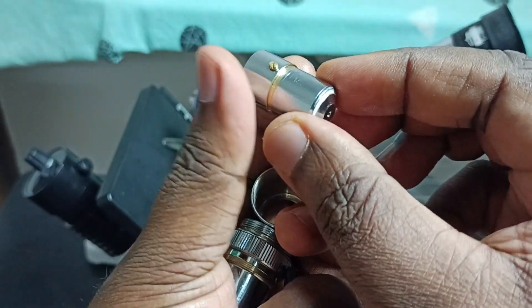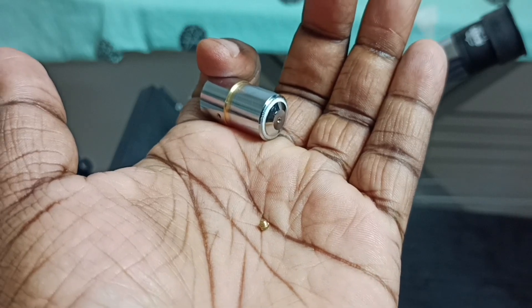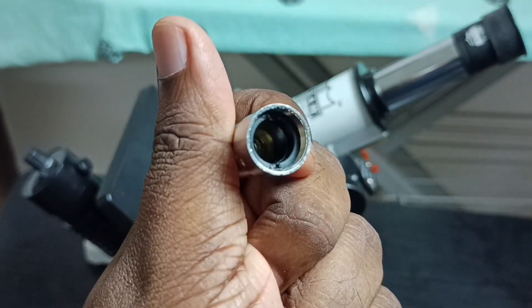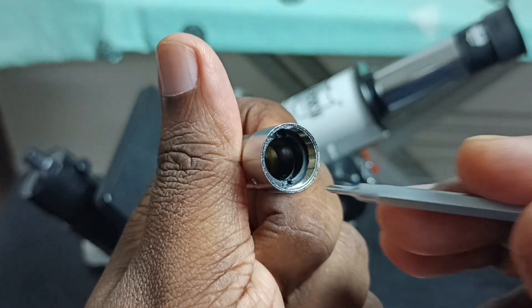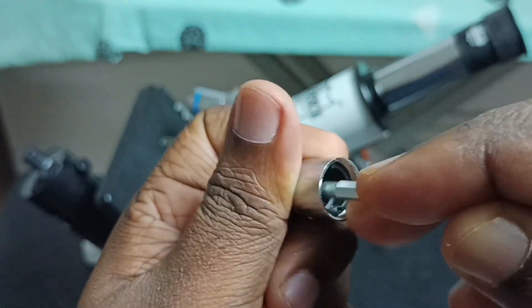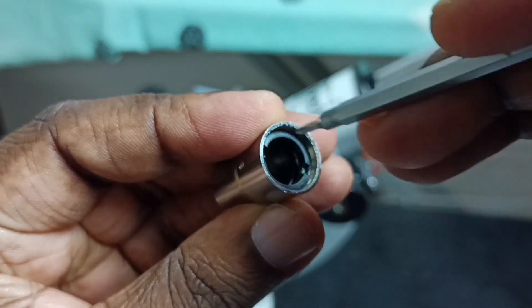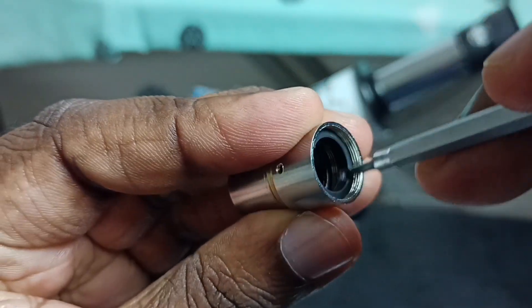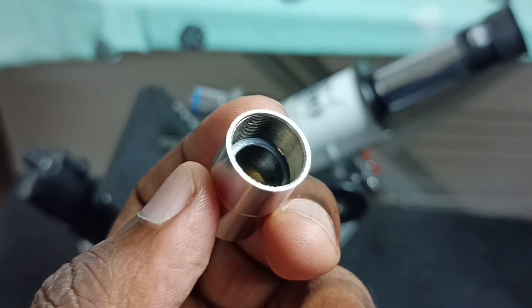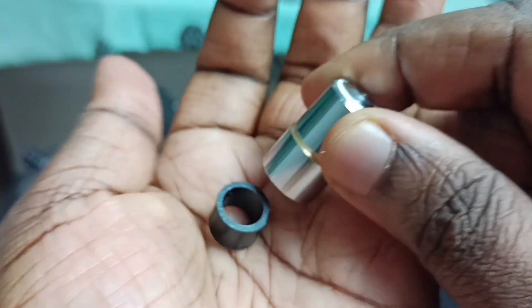Let me take this lens outside. I have removed that screw with a small screwdriver. Then inside, we have to take this plastic outside and just rotate it. I have removed that plastic, so let me check what is inside.